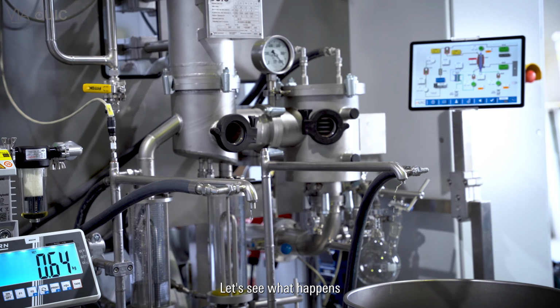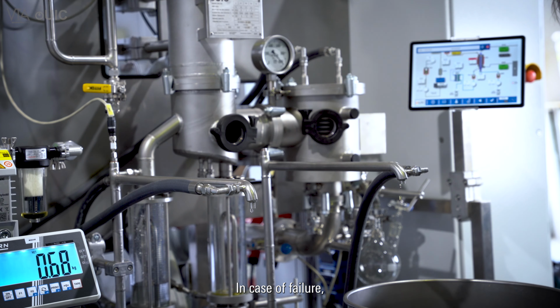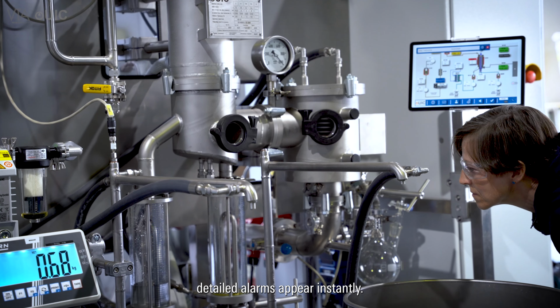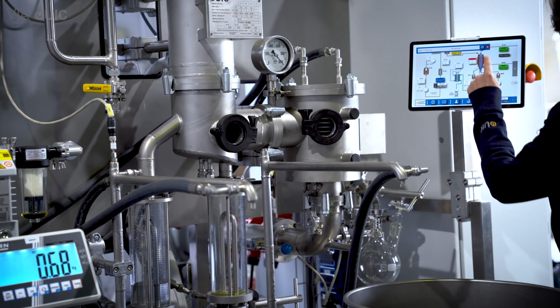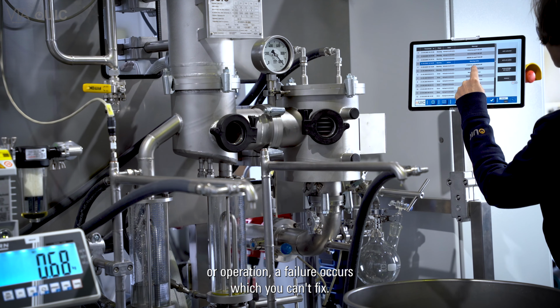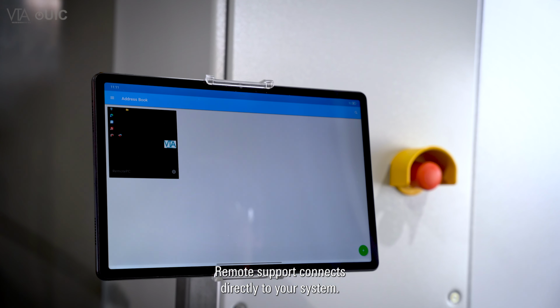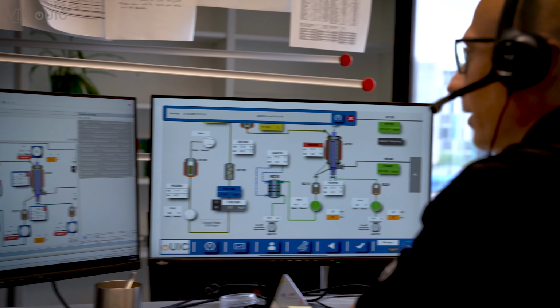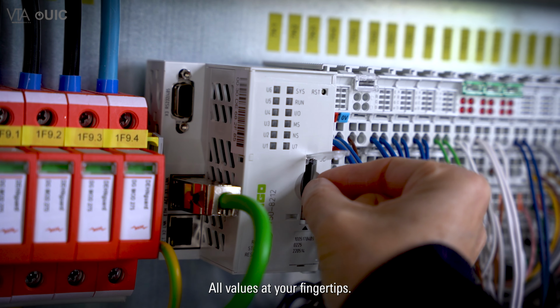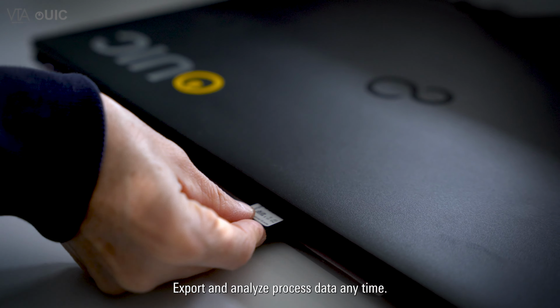Let's see what happens if something goes wrong. In case of failure, detailed alarms appear instantly. If during commissioning or operation a failure occurs which you can't fix, remote support connects directly to your system. All values at your fingertips. Export and analyze process data anytime.